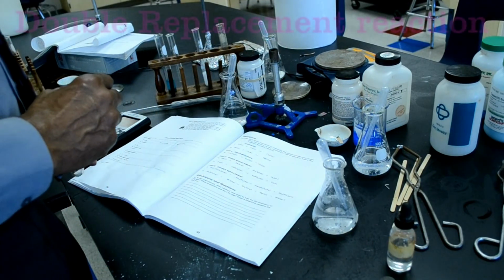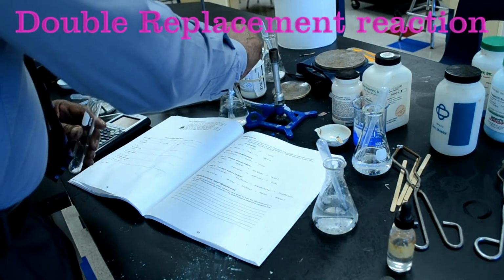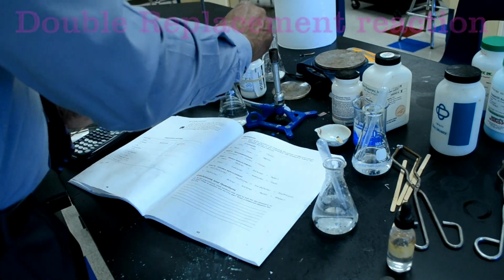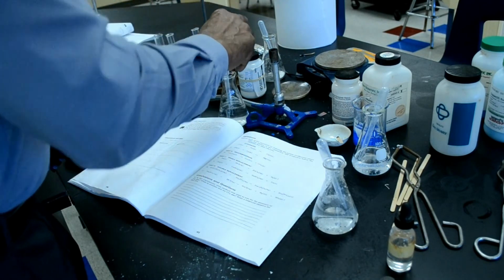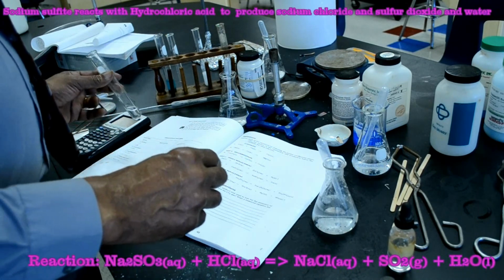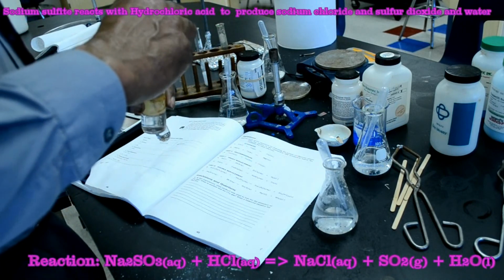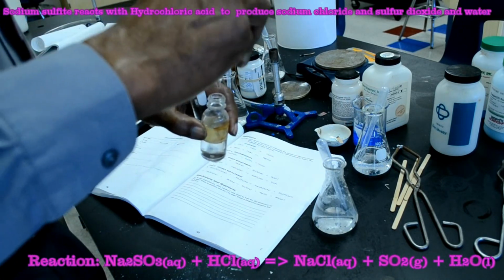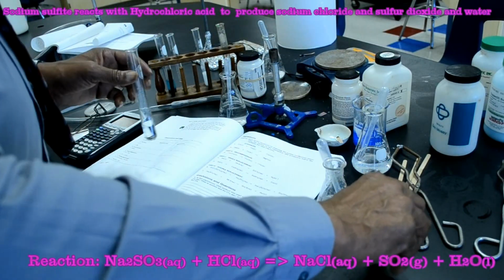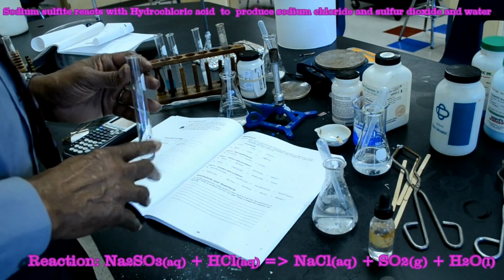Number 10 states, add about 5 mLs of sodium sulfite. Add about 5 mLs of sodium sulfite. That's about 5 mLs. Solution to a clean, dry test tube. To this solution, add about 5 mLs of 6 molar HCl. This is also a double replacement reaction, by the way, although a precipitate does not form here.